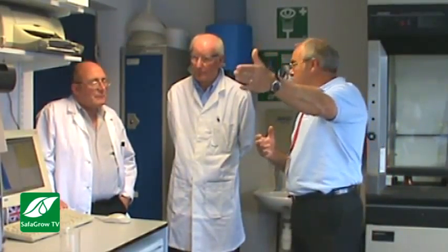It's quite an important part of the setup here with regard to checking raw materials. Now, one of the things that interests me, apart from that, I see you've got apparatus here. I think that's chromatography over there. This one here is to do with analysing for particle size. Yes, correct. Why should we want to do that?